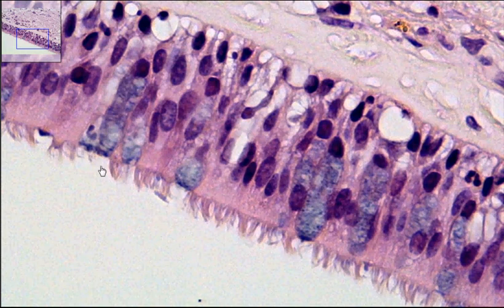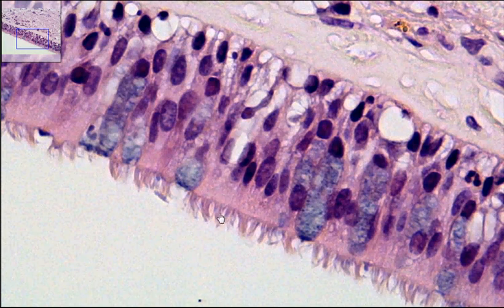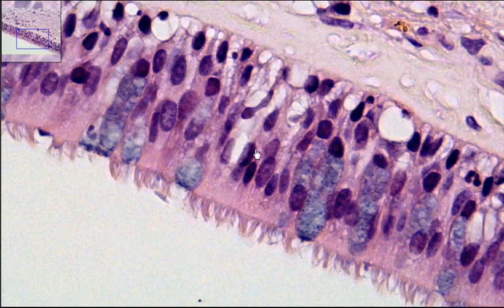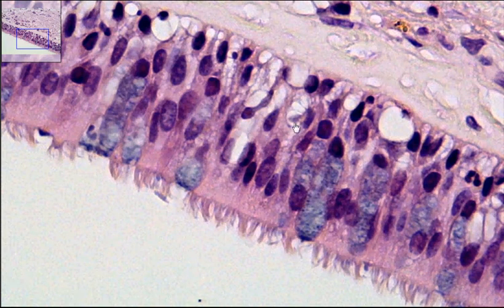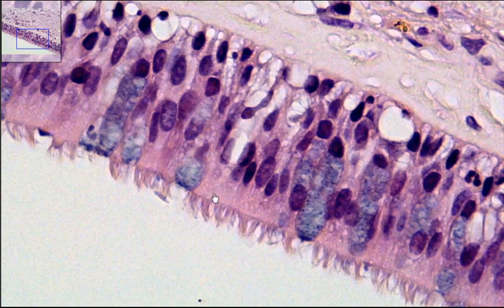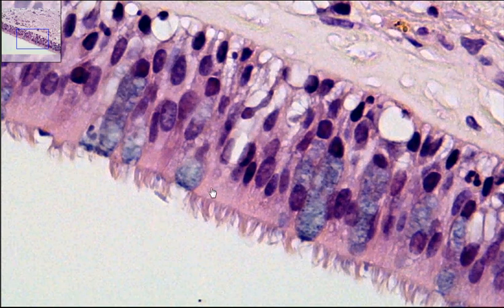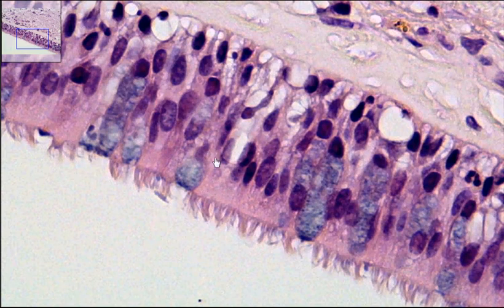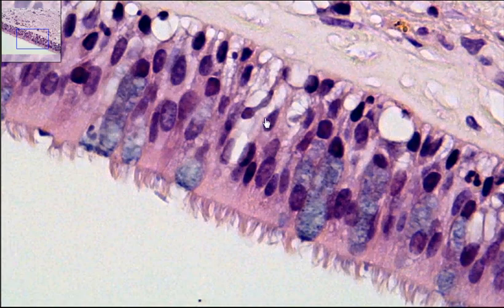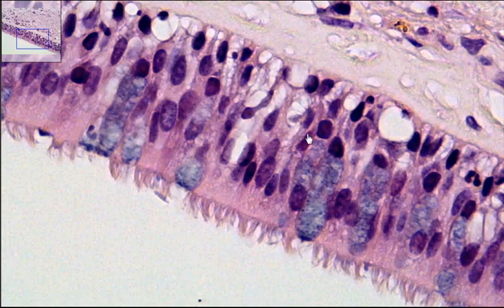The cilia can then help move the mucus. These cells right here are the actual columnar cells. You can see these purple dots — these are the nuclei.